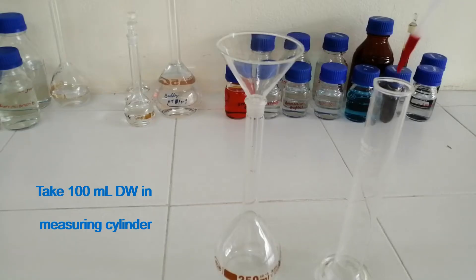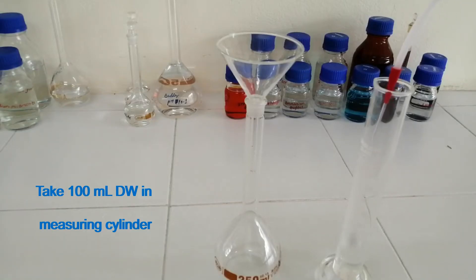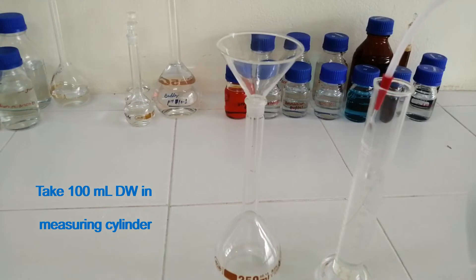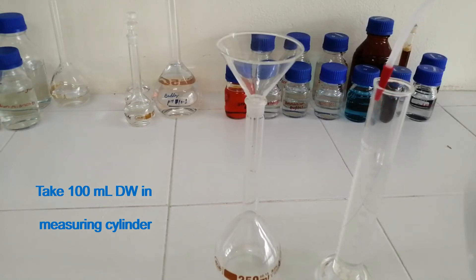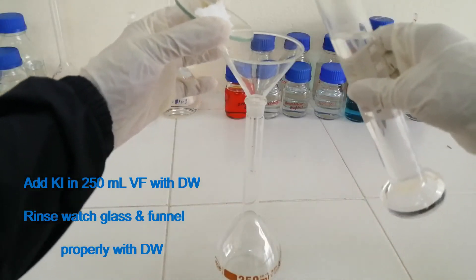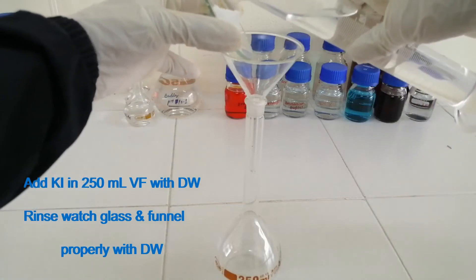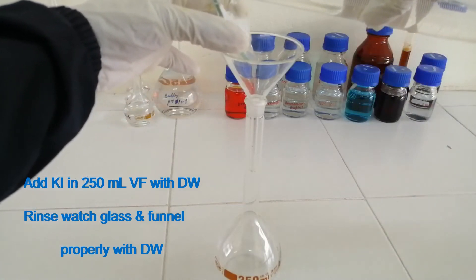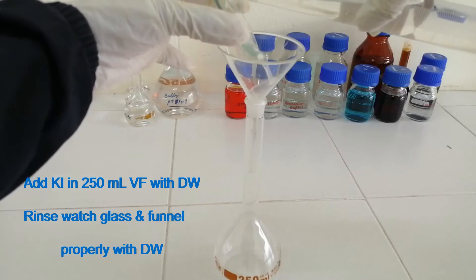Take 100 ml of distilled water in a measuring cylinder. Add the weighed amount of potassium iodide into a 250 ml volumetric flask with distilled water. Rinse the watch glass and funnel properly with distilled water.